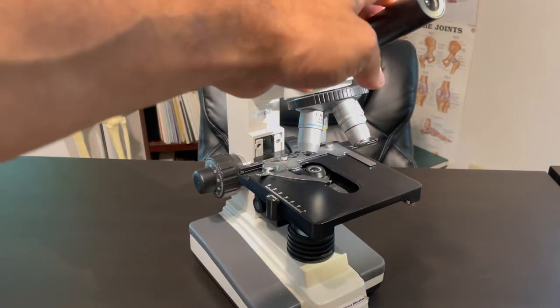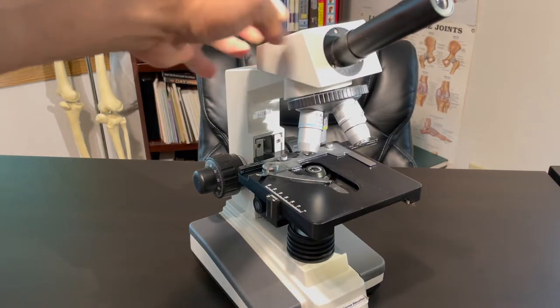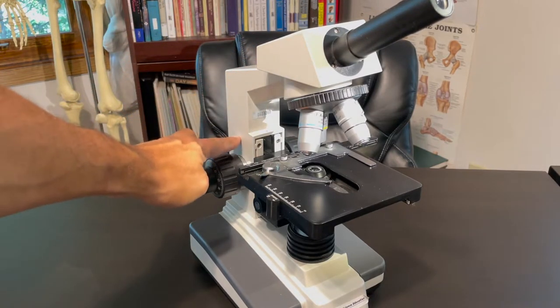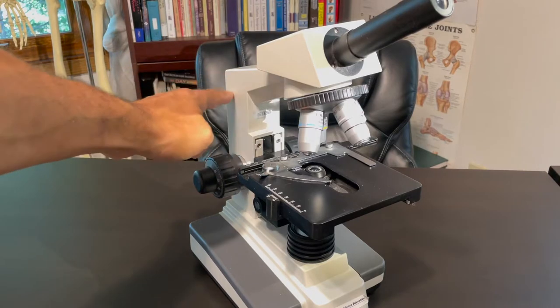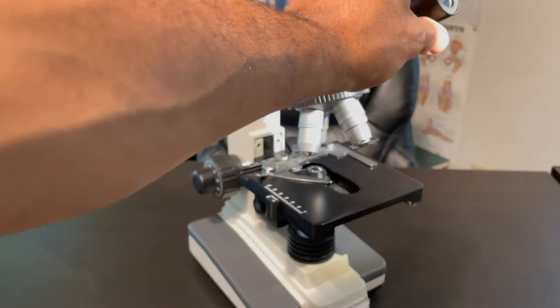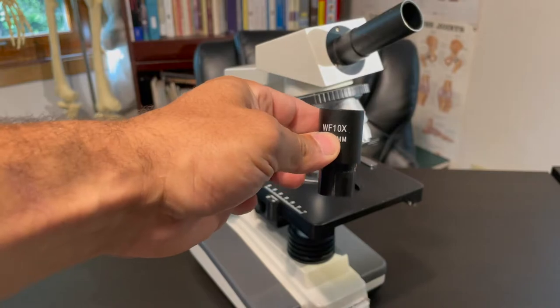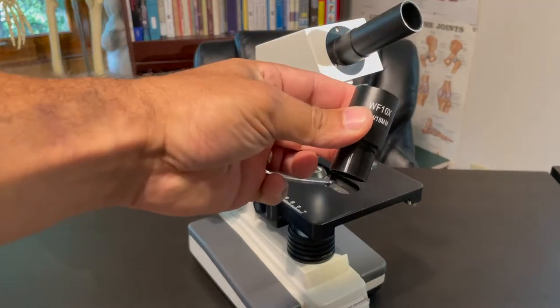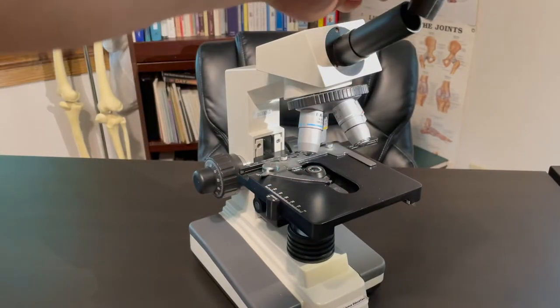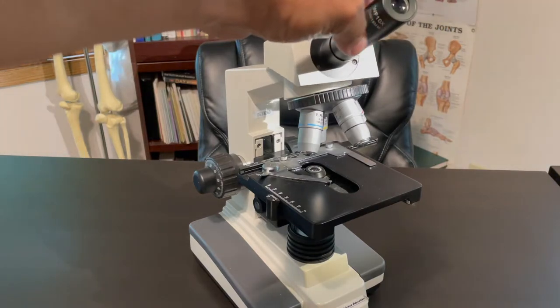We have the head. This is the head that we were spinning around. You have the arm that the head's attached to. You got the arm here and you got the base down here. This top piece, this is the eyepiece or ocular lens, and this has a magnification of 10x. You don't usually take this off. You don't need to take this off for any reason. I'm just doing that just to show you.